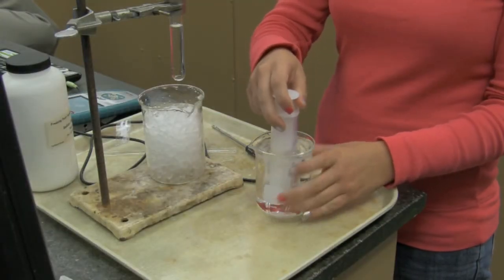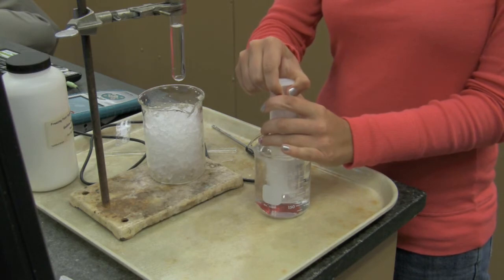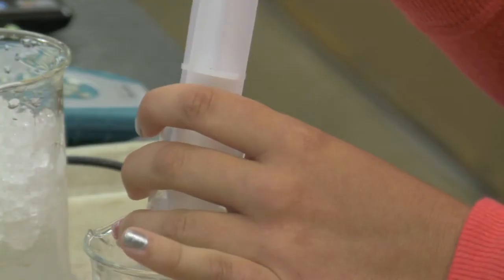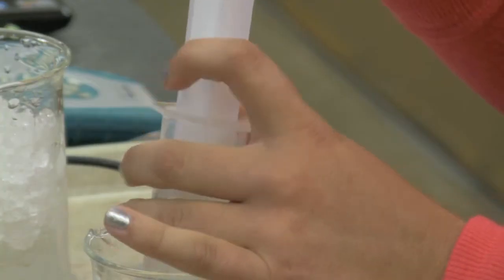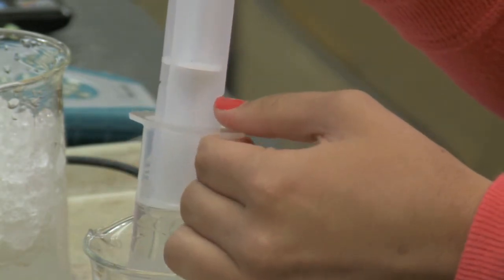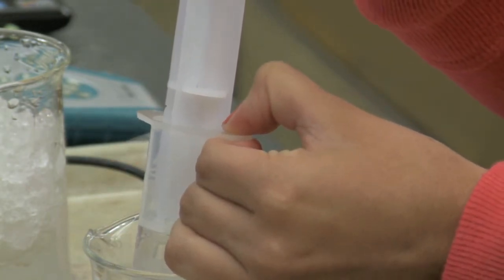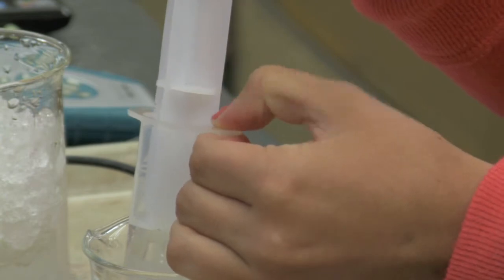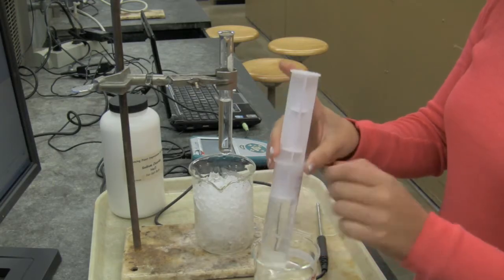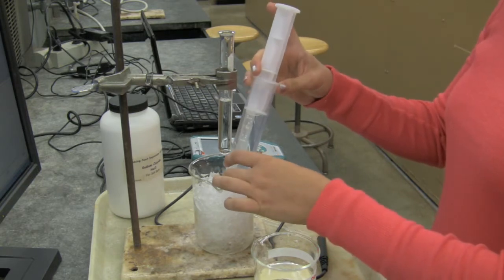She has placed a syringe in a beaker full of DI water to her right, using the notches along its surface to measure the proper amount. She then empties the DI water from the syringe into a beaker full of ice water.